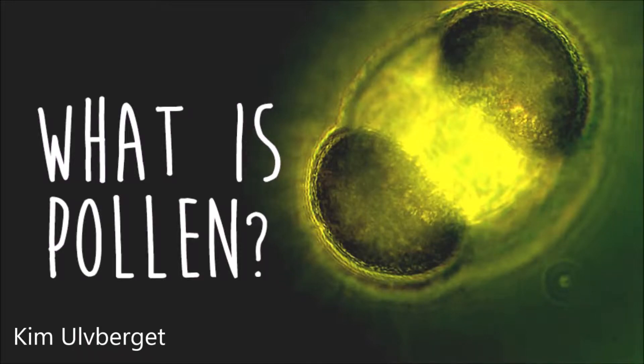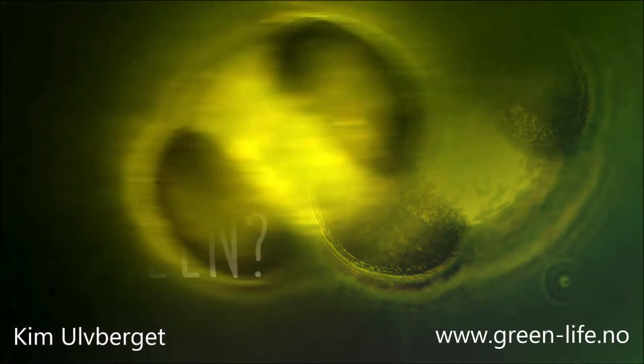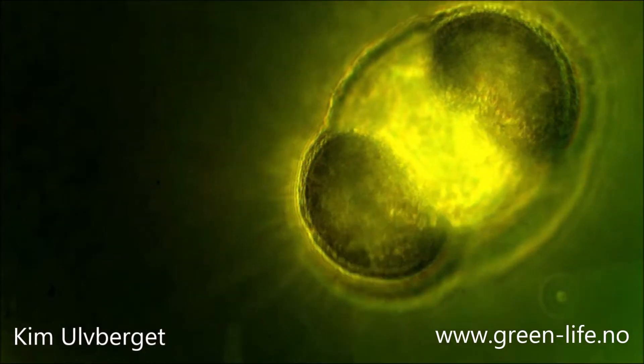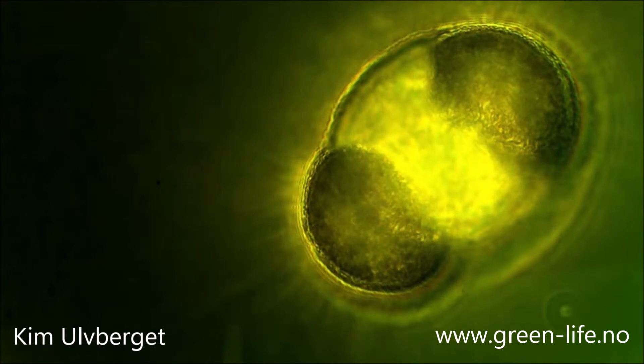What exactly is pollen? In this video we've collected cedar pollen. The pollen grains have a hard coat for protection and contain the nucleus and DNA structure of the plant.